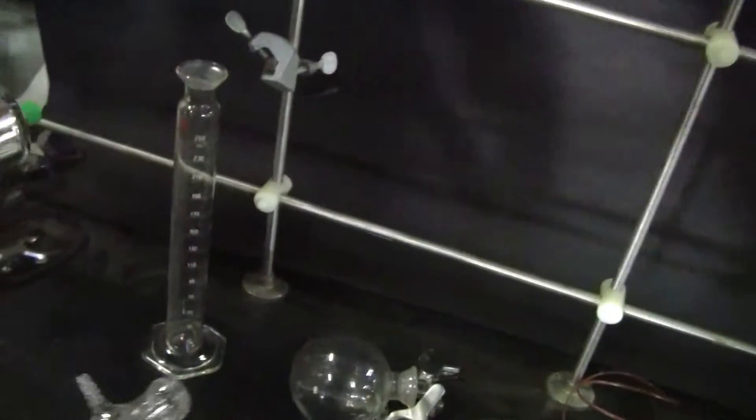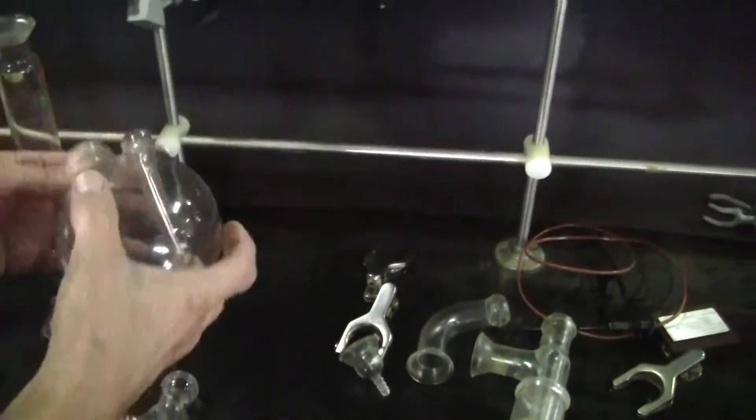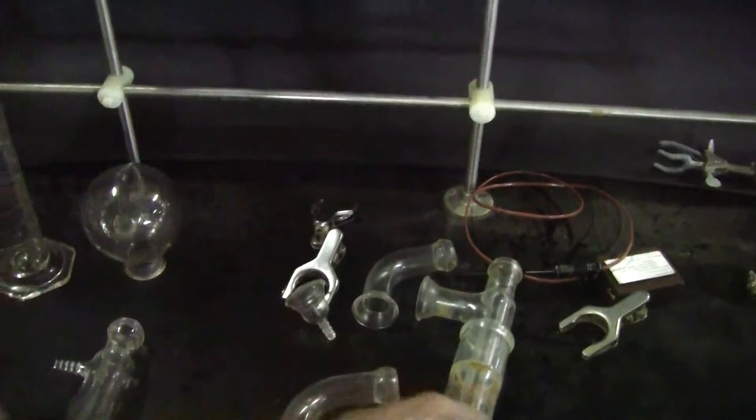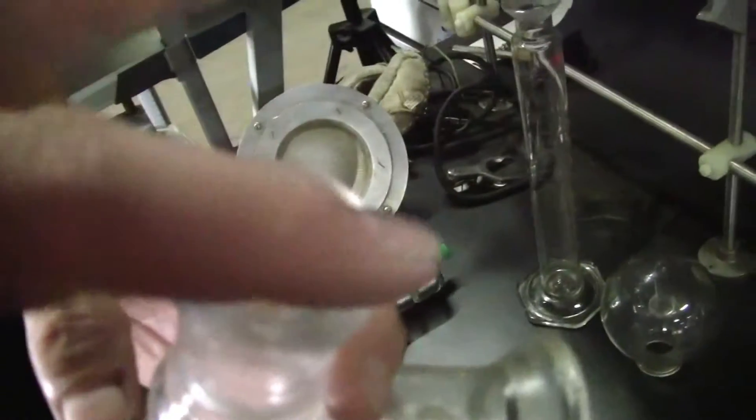Okay. This is just the graduated cylinder. Looking good. This is just a little grease that you see up top.